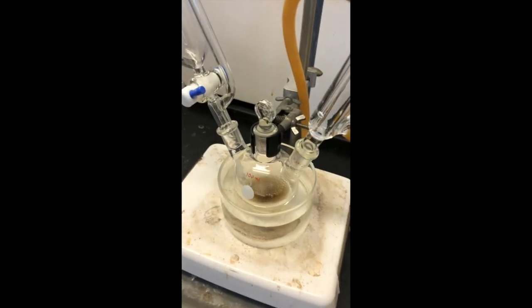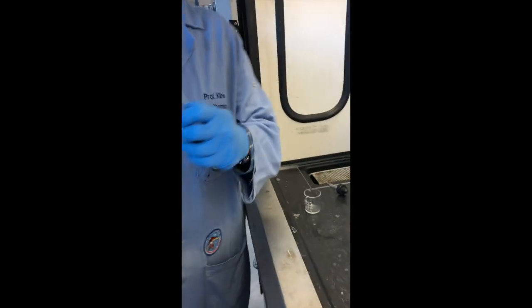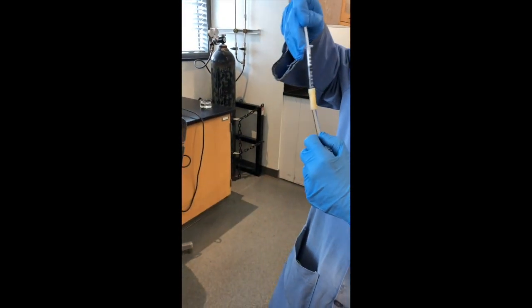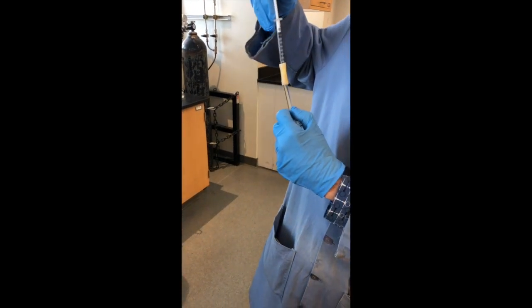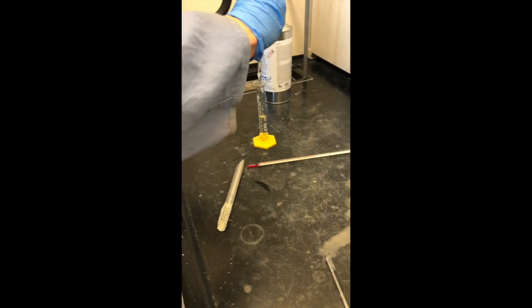So we're nearing the end of the 20 minute reflux period. And we're getting ready to measure out the acetophenone. So we're going to measure out 0.8 ml of the acetophenone and put that into 6 ml of ether.